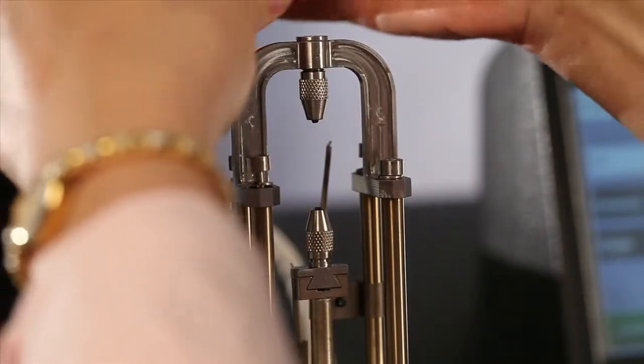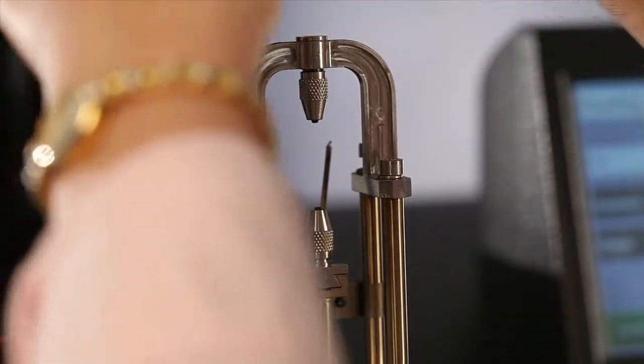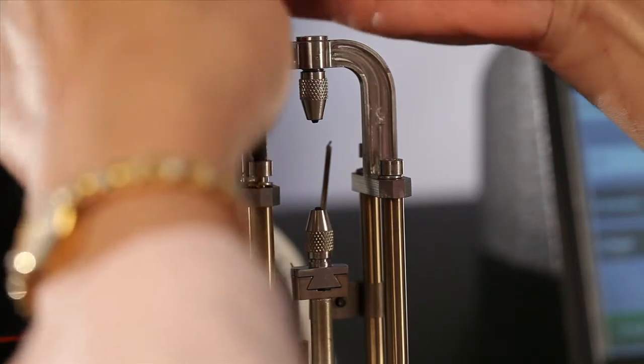Tighten all the screws with the Allen key that's provided in the clamp kit.